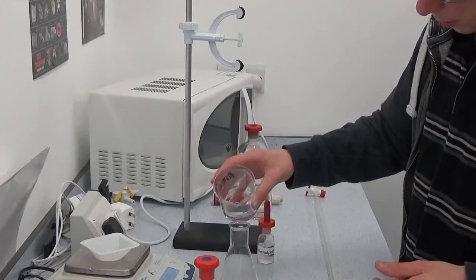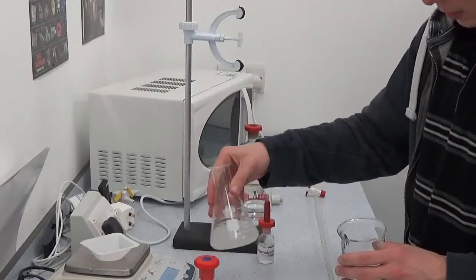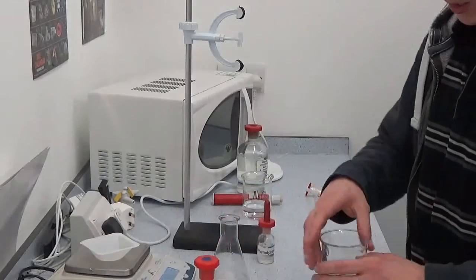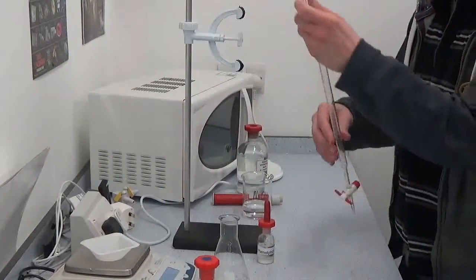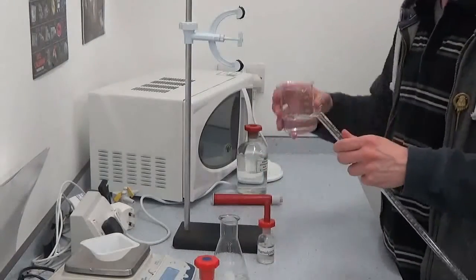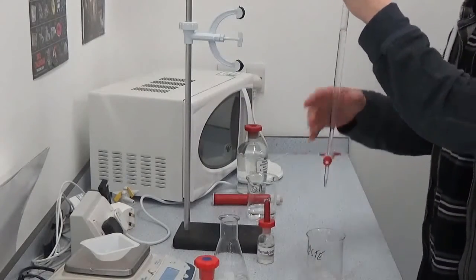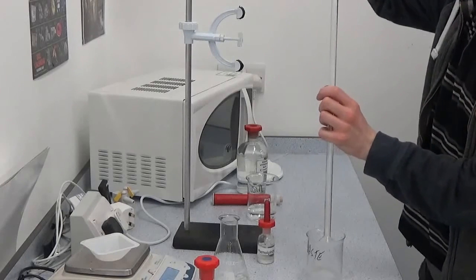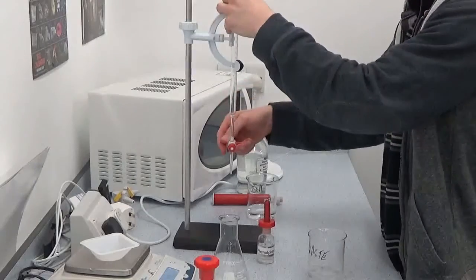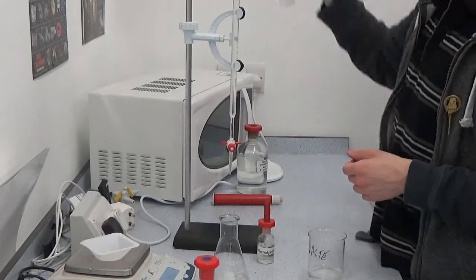I know I'm going to be in excess when there's no more fizzing — the carbonate releases carbon dioxide, so if there's no more of that going off, then I'm definitely in excess. Now you would have your burette — fill that up with sodium hydroxide, any base that can react with the hydrochloric acid. Add a bit of sodium hydroxide in, clean the burette out, make sure the tap is closed, and fill up.